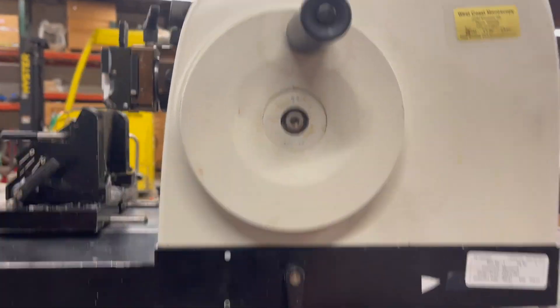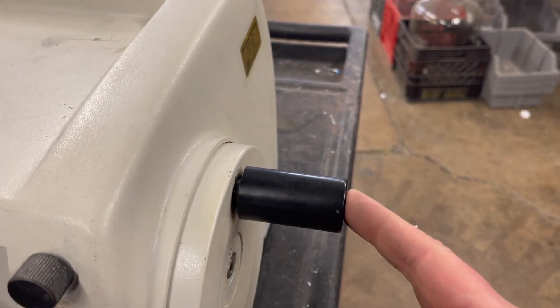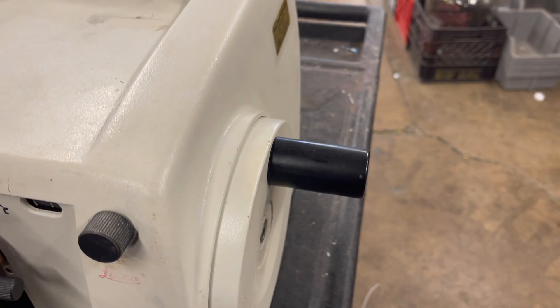But this particular Leica Microtome has a second hand wheel lock, and that's the actual handle. So if you push the handle in, you'll hear it snap, and now it's completely locked.